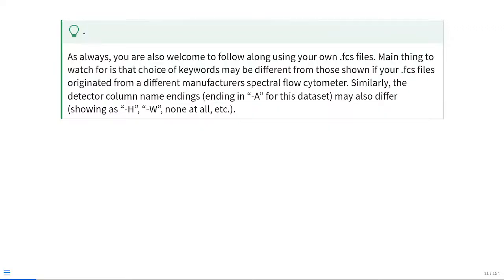The dataset we're using today was acquired on a Cytek Aurora. The main thing if you're using a platform from a different manufacturer would be the choice of keywords. So in this case, later on when we do the file renaming, we're using both group name and tube name. Tube name is not actually found in all different manufacturer keyword lists, so you may need to vary that a little bit here and there. And then even on a Cytek Aurora, most of the instruments' defaults are just going to be acquiring -A, meaning area, but you have the option to also be including -height, -width as well, depending on what you selected in your instrument control setting. So this may not even be universal for all Auroras, so these are a couple things to just be aware of before you go and try your own data set.